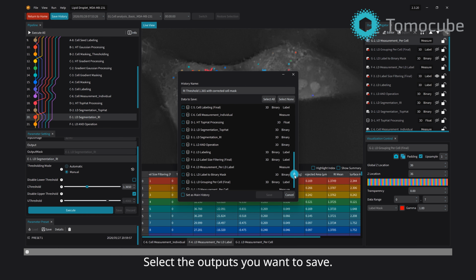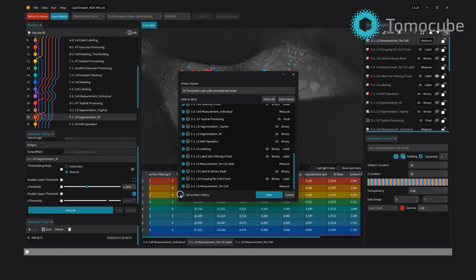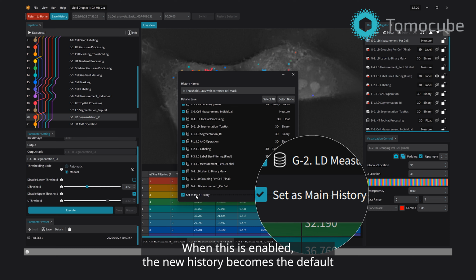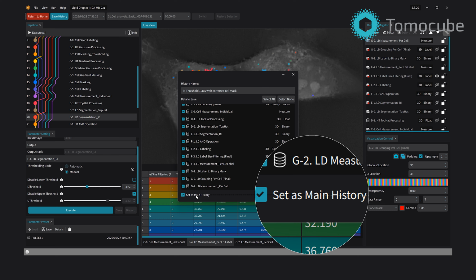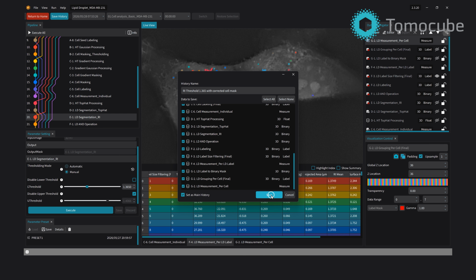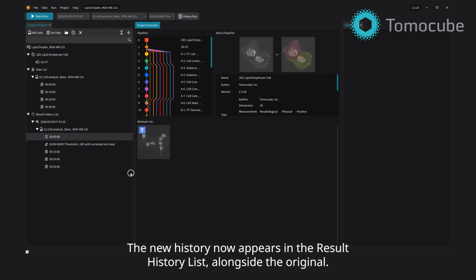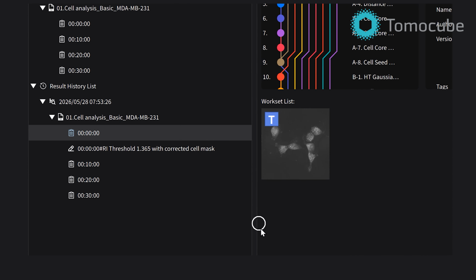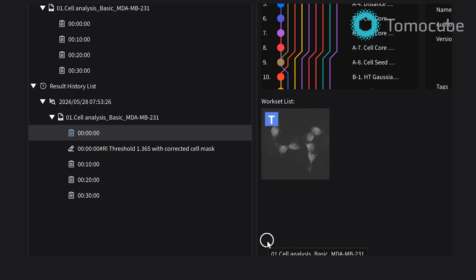Select the outputs you want to save. You'll also see an option called Set as Main History. When this is enabled, the new history becomes the default version displayed in the result history list and used for export. Enable this if the refined version is the one you want to treat as your primary result. Click Save. The new history now appears in the result history list, alongside the original. Both are preserved. You can always compare them or go back to the original if needed.